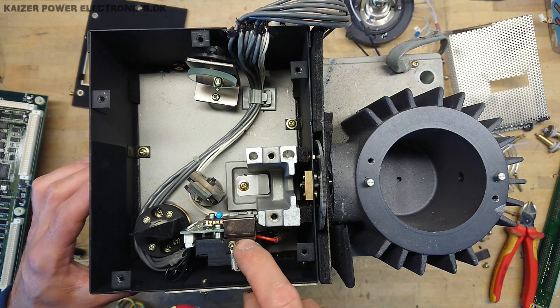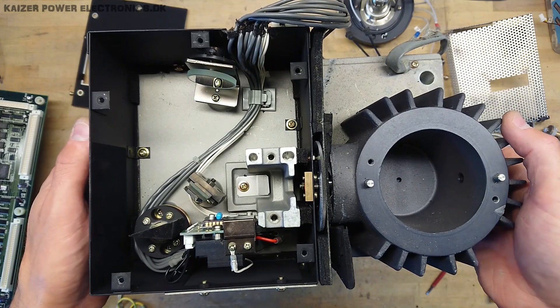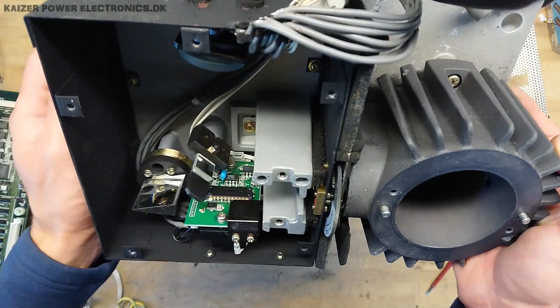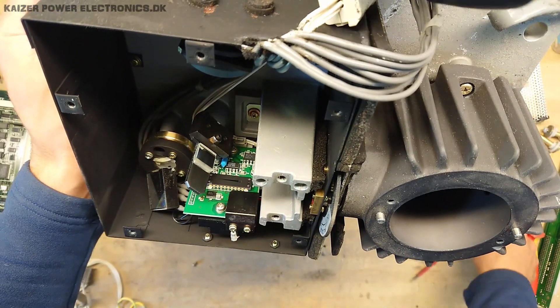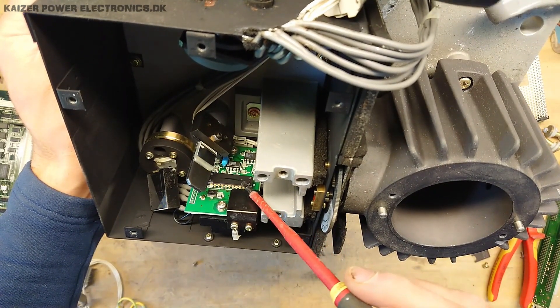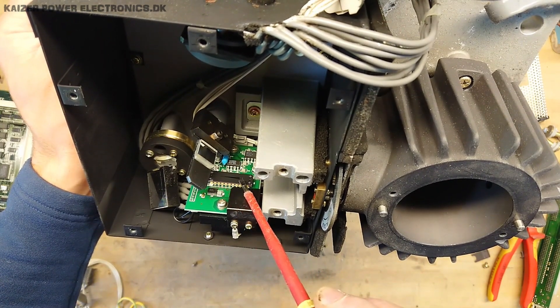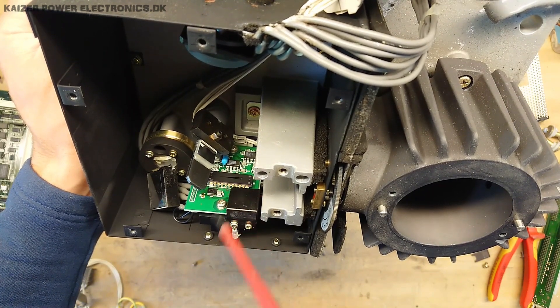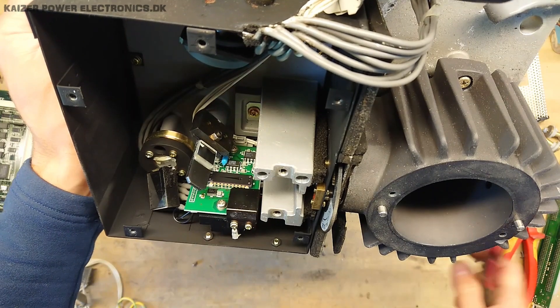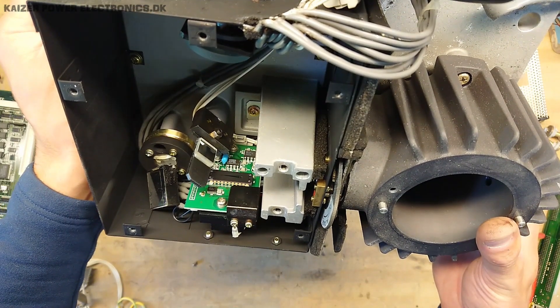Getting the prism out — there it is! I thought that was just a gold-plated chip, but that's the actual detector. Look at that — gold-plated legs, and here we have the open slit, which narrows based on the wavelength it wants to detect. Since it's already broken, let's get the board out and take a closer look at that detector.